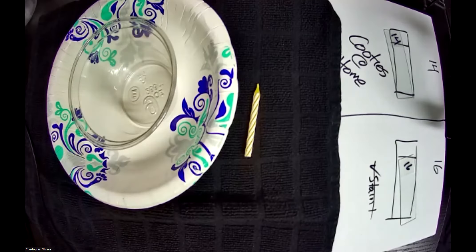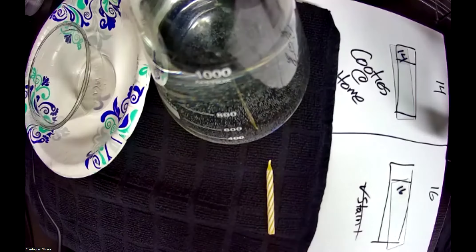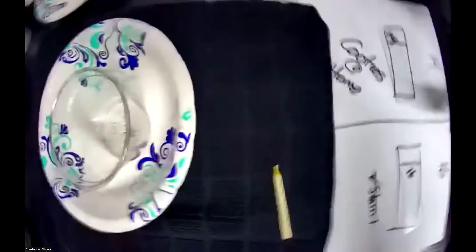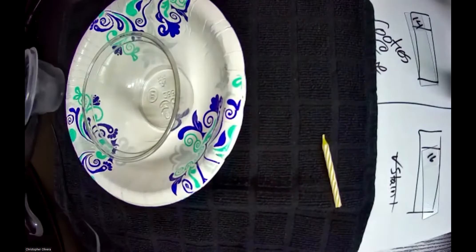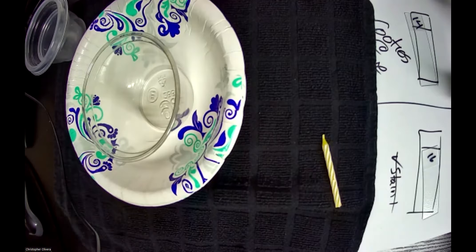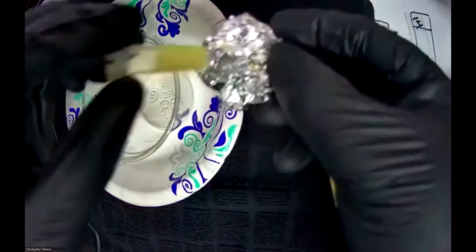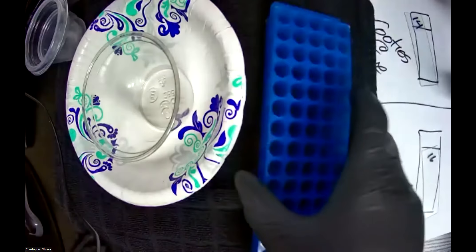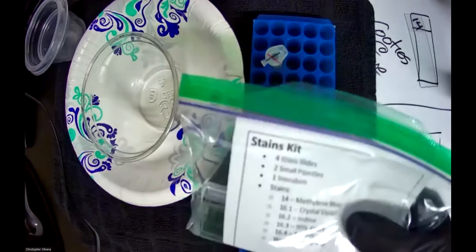I usually also have a container full of water. I have a beaker — actually an Erlenmeyer flask — full of water in this case, but you can use whatever you wish: any bowl, any bottle, anything. I'm going to put it off to the side and I'll create a bunch of little aluminum foil holders so they can hold my tubes. I happen to have professional ones so I don't need to make those, but you probably will.